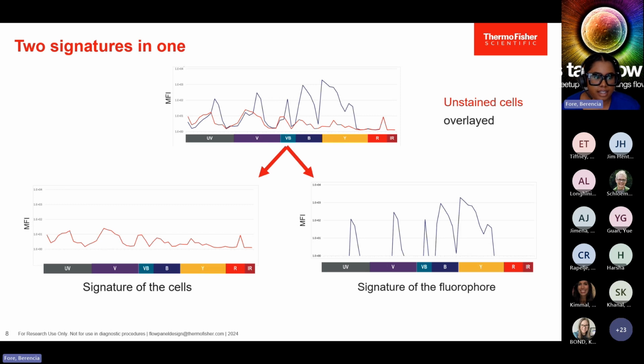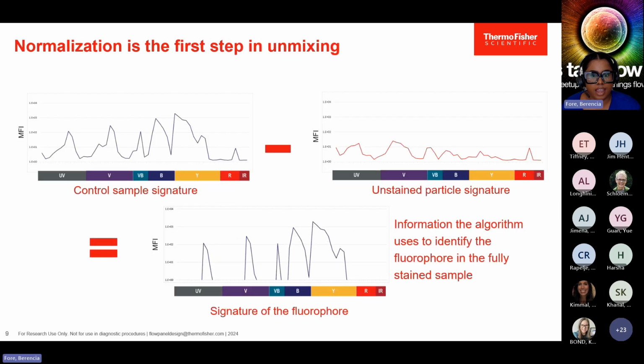Here on this slide is another illustration of the same thing. In the blue, we have the signature of the fluorophore. In this example, cells were used as the reference control. In the red, we have the unstained cell signature, or just the autofluorescence signature of the cells in the reference control. So you can think of your actual reference control as two signatures in one. Normalization involves taking that unstained particle signature and subtracting it from the control you're using. This in turn gives you the signature of the fluorophore, which is the information the algorithm uses to identify the fluorophore in the fully stained sample.